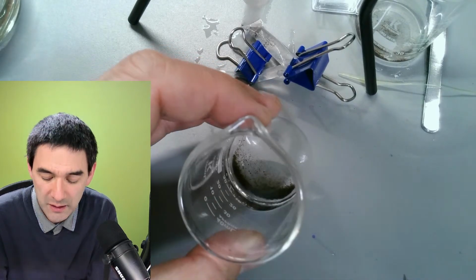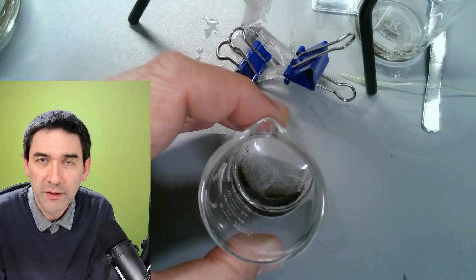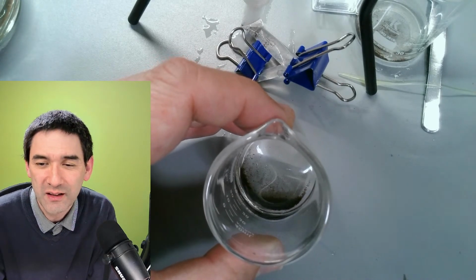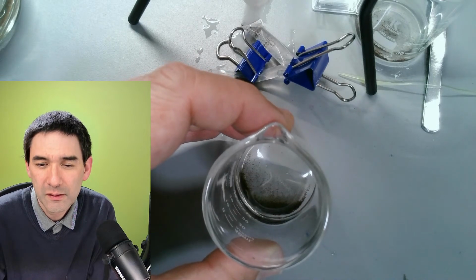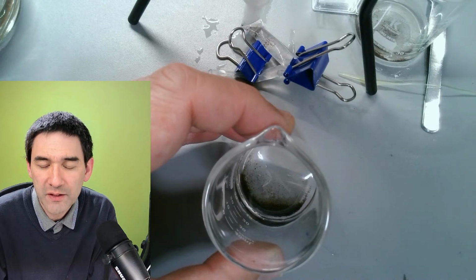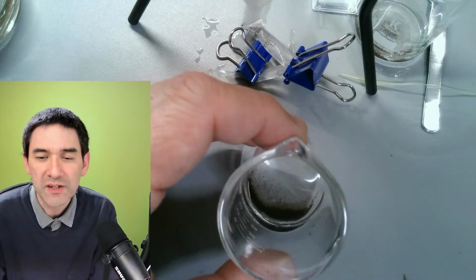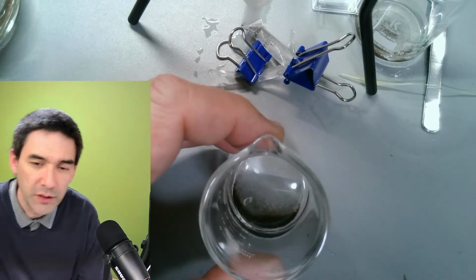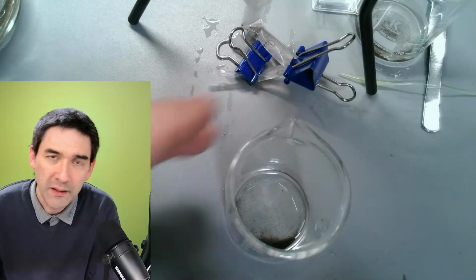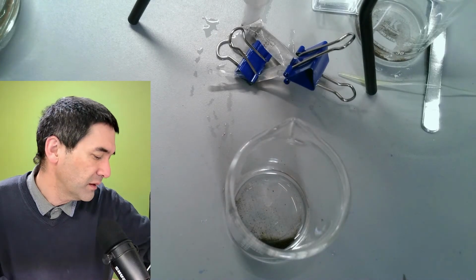Yeah, because it's already an improvement on what I have here, but if you are then using filter paper, everything's going to be held back, and you probably don't see anything. Yeah, I'm using a 250 micrometer mesh for mine. I also have some 500 micrometer and 850 micrometers. 850 micrometers is almost a millimeter, right? So that's already pretty coarse, and I guess it's fine, because it's supposed to only hold back the sand and the larger particles.